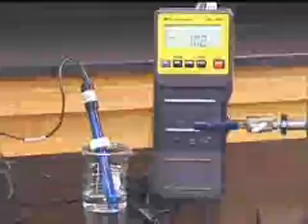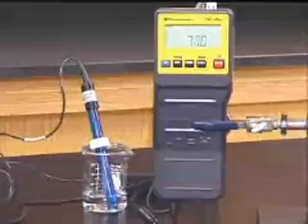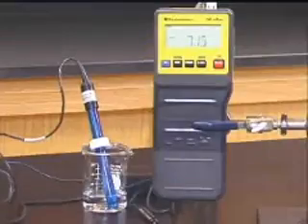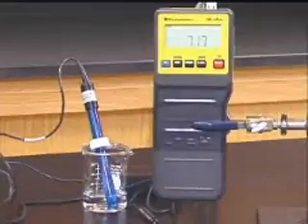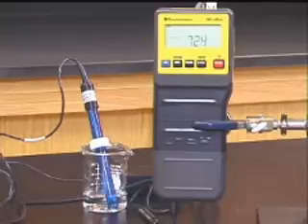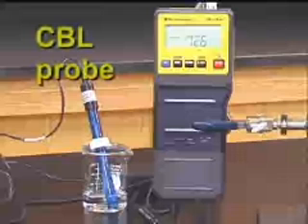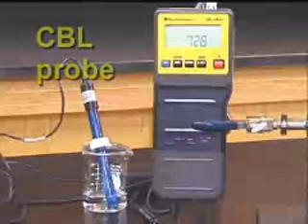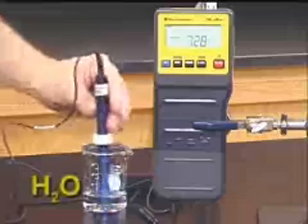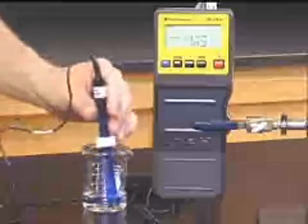We're going to look at the pH of a number of buffer solutions and see how the pH changes as we add acid or base. We're going to start out, however, looking at a solution that is not a buffer, which is pure water. I've calibrated a CBL pH probe, and I'm going to put it into some distilled water. Our solution starts out being relatively close to a pH of 7.